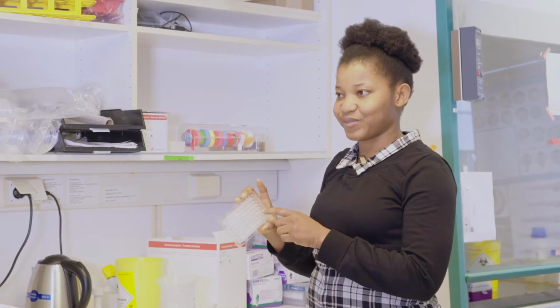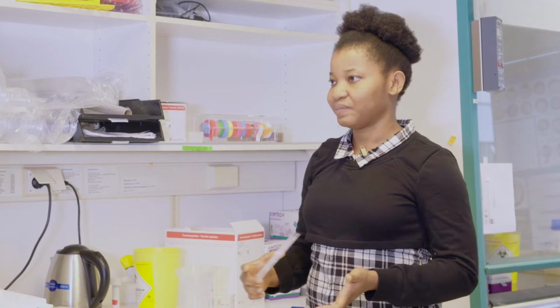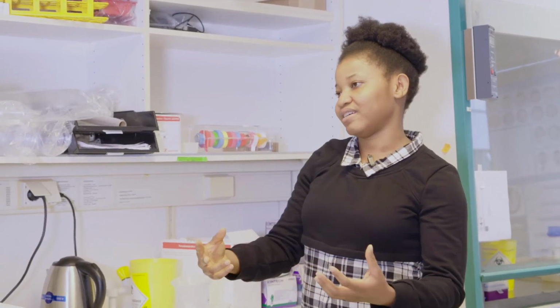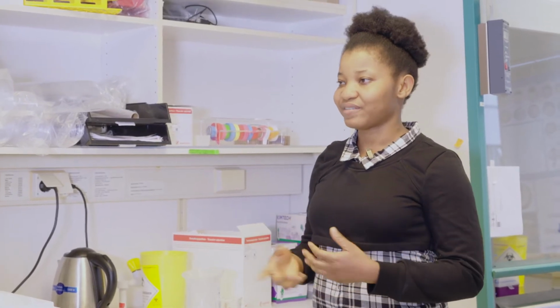So they are able to fit into these tiny well plates, and then you can put them under a microscope or a camera and observe them in detail. Another thing is that they are optically transparent up until about 7 days old. Because of that, we don't have to euthanize them and slice their brains to find specific areas. Under the microscope, until 7 days old, we can just work with them whilst they are alive. Also, they are genetically tractable. That means most of the tools that we need to edit the genome are available in zebrafish.